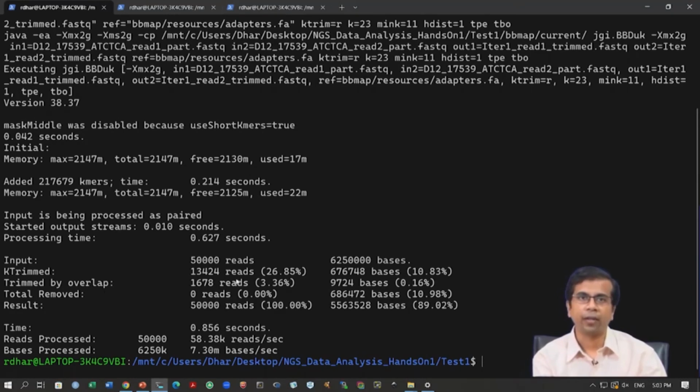It has also trimmed other reads. These are 2 different ways it has trimmed. So, 1,600 reads, again 9,700 bases. It has not removed any read completely, so total removed is 0 reads. It has all the reads, 50,000 reads. The trimmed data contains all of these, and the bases will be around 5.56 million. So from 6.25 million we have now come down to 5.56 million. It means some sort of trimming has happened, and then there are some speeds, how much time it has taken, etc.